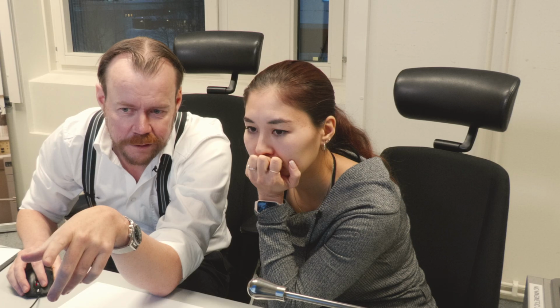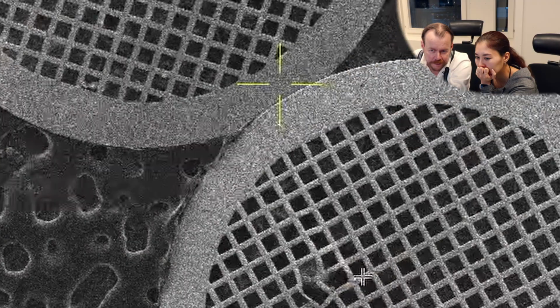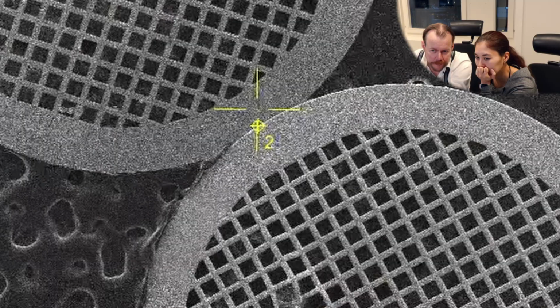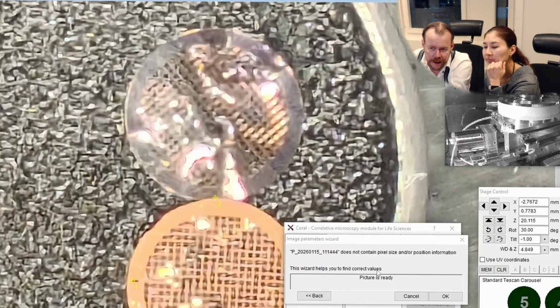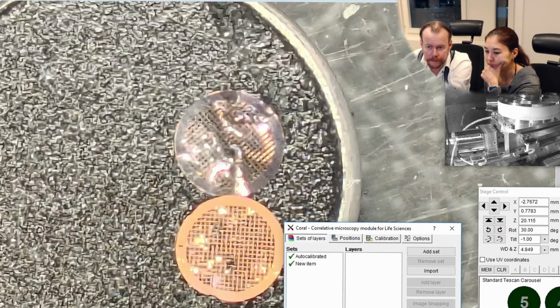And then we take a second one, and then we can try to find some other thing to navigate. We can try to guess exactly the midpoint between these 2 grids. Let's try that. That's about here. And then it will be about here. So now we have a correlated, calibrated image. Click OK.